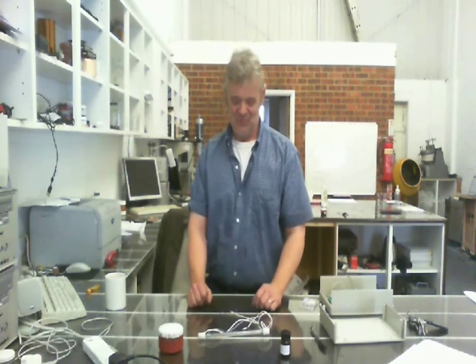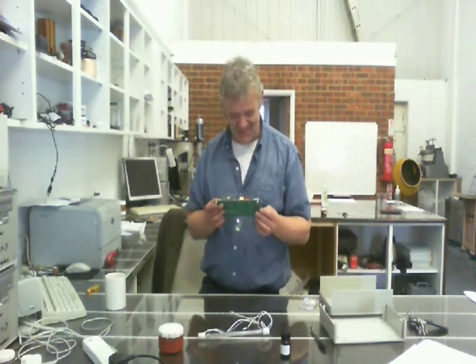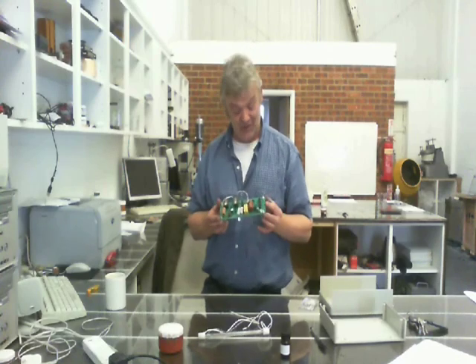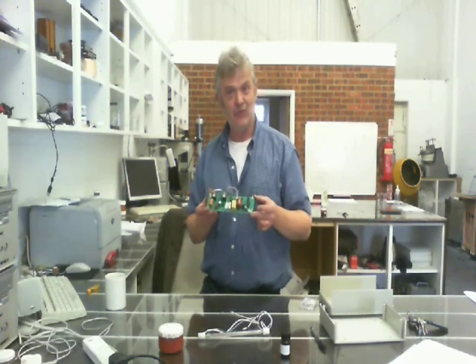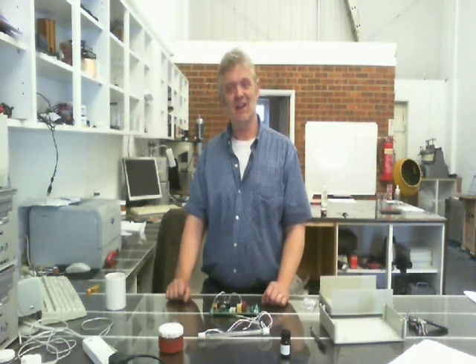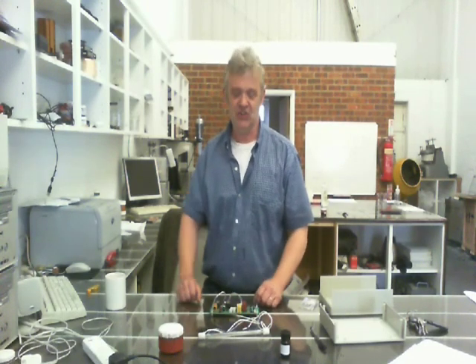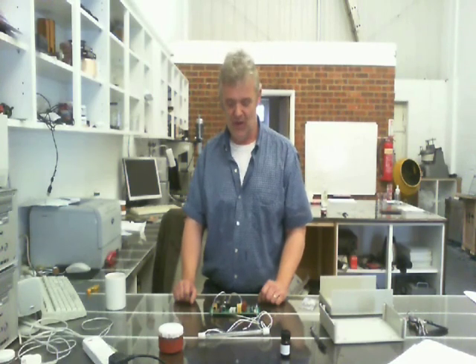In order to get that to work, what I clearly need to do is build a driver circuit. Now, you can build a driver circuit if you want, and you can get all the components together and solder them all together and do the job very nicely. However, the same people who sell that, quite thankfully, sell this. And this is the driver board for it. It's all put together, it cost me £25, and it's ready to run that lamp. So, for £50, I got the complete setup in order to make a flash unit. Now, clearly, the only thing that I really need to do then is put it into some kind of enclosure, solder those bits together, and solder on some wire to plug it into the mains. And that's what I'm going to do.